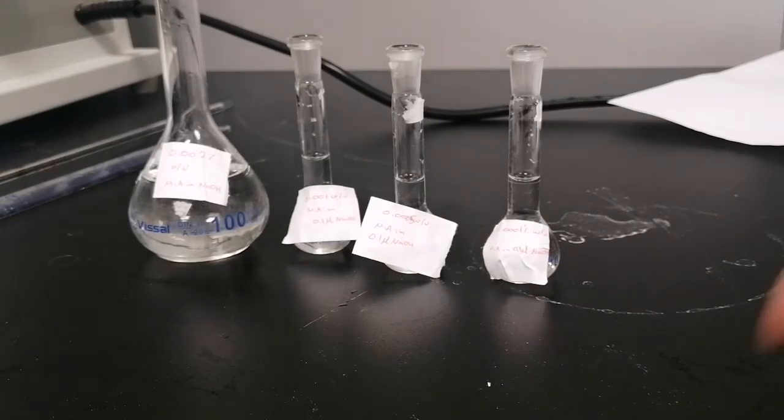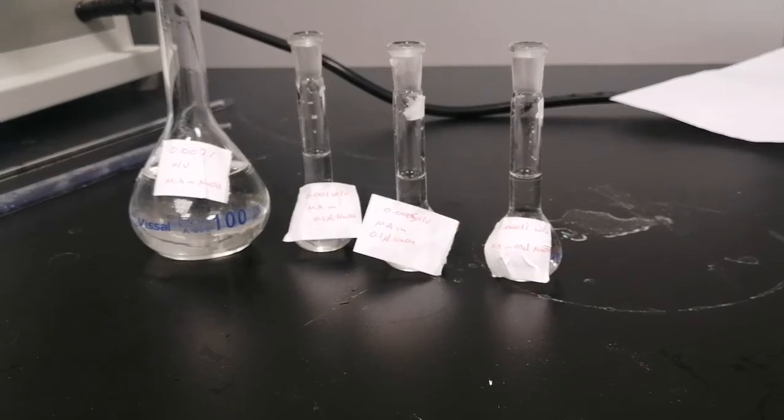We will use a blank of sodium hydroxide for these solutions in order to measure the absorbance of mefenamic acid, and we will wait for the 15 minutes shaking and then filtration of the mefenamic acid in different pH buffers in order to calculate their solubility in different buffers according to the pH difference.